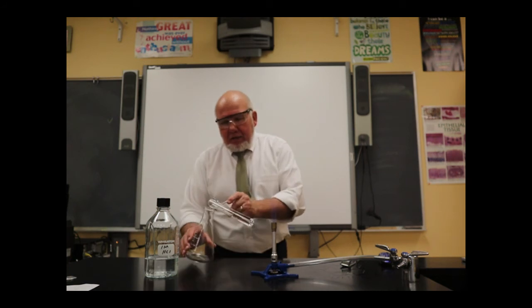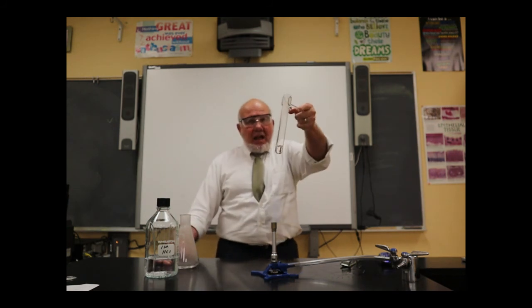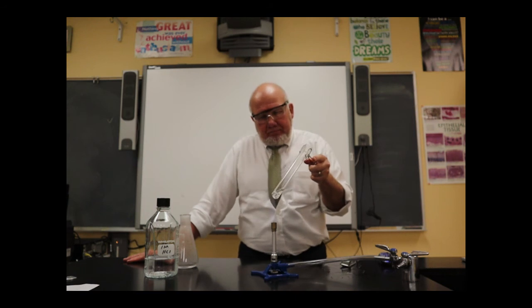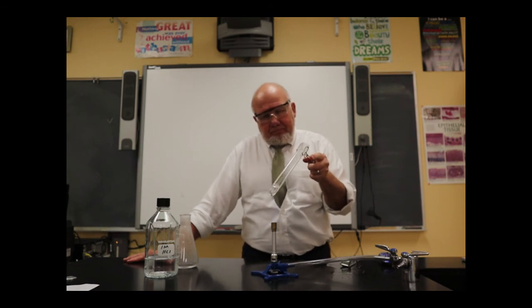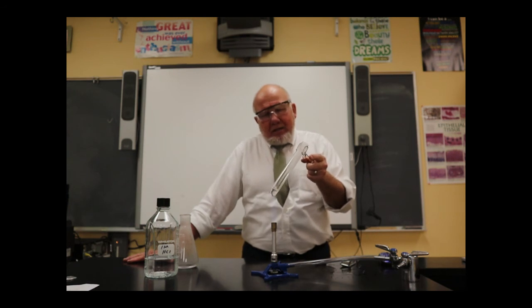Let's take less. And because I want to show you that there is a compound in there, that would be much better to work with. So let's see if we can boil off that liquid. And see, that's about what I'd want to use next time I do this experiment. About that much if I could get away with it. Because it's not as much to boil.